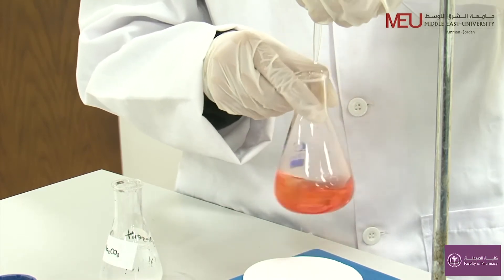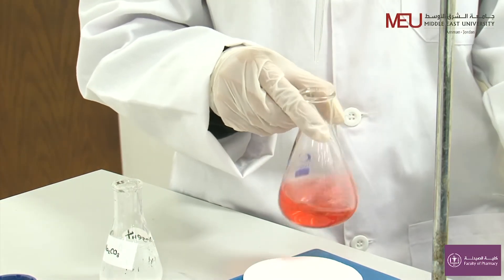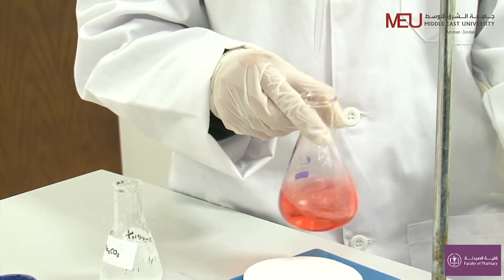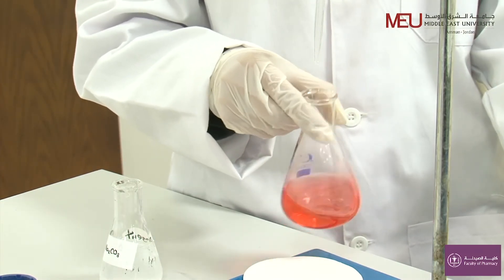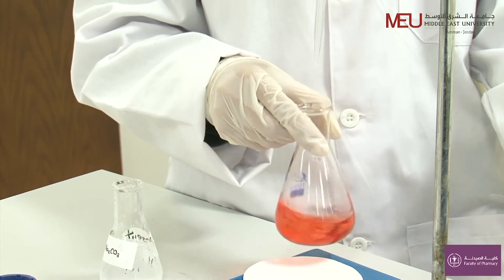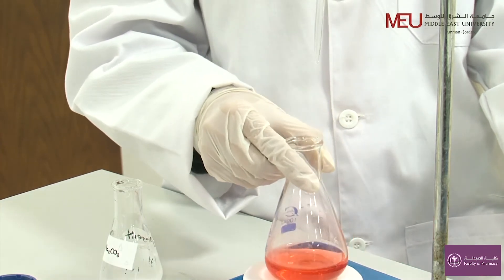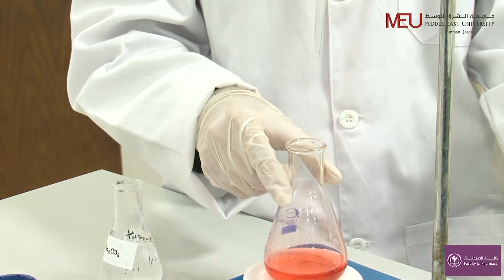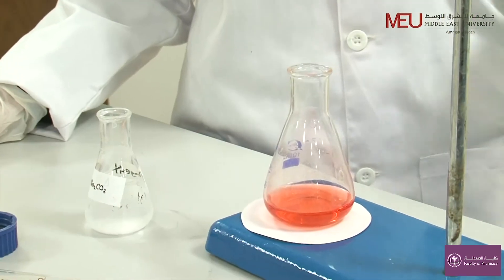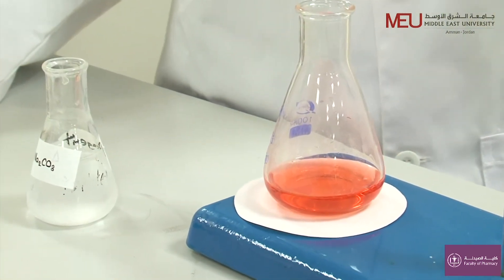Now, when I consume all the base and I have excess acid, the solution will turn to pink, as you can see. Record the volume of the titrant and start your calculation.